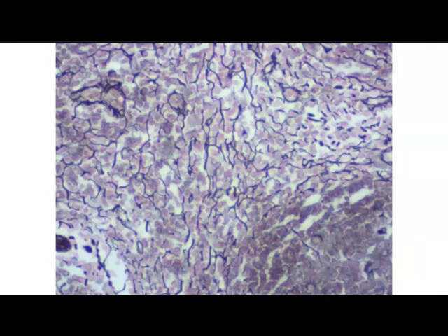So this slide, or the next couple slides, are going to be the third type of your loose connective tissue. We have the reticular tissue, reticular connective tissue. So we will find this, of course, in our spleen and lymph nodes and lymph organs. You can see the reticular fibers here within the tissue. So this helps you identify this as reticular connective tissue.